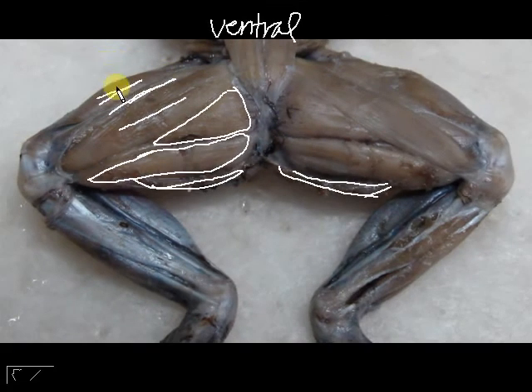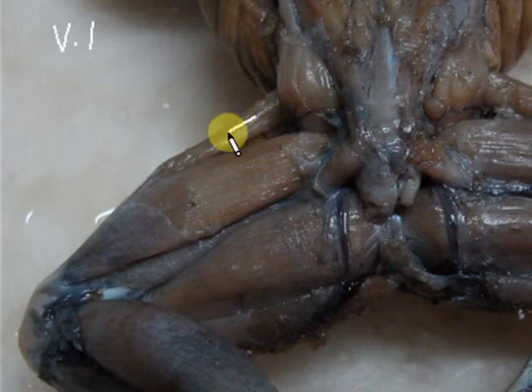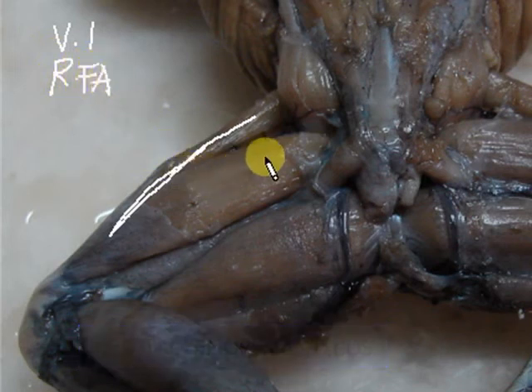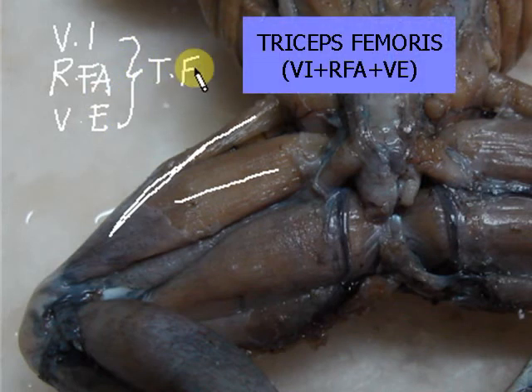Alright, so I want you to remember this one, which is your vastus internus. Now we will look at the dorsal view of the thigh. Now the vastus internus, so that's one. Now this next one is the rectus femoris anticus, and then this third one is the vastus externus. So these three combine to form the triceps femoris.